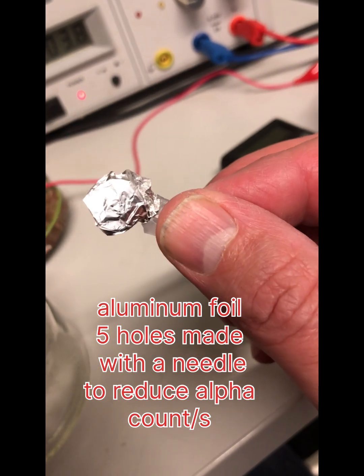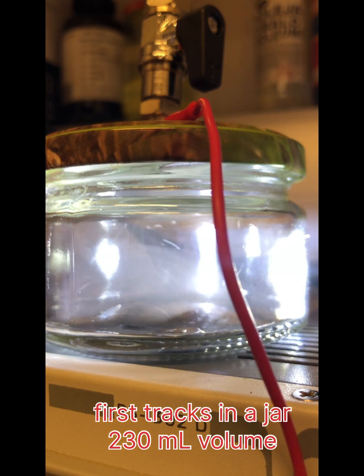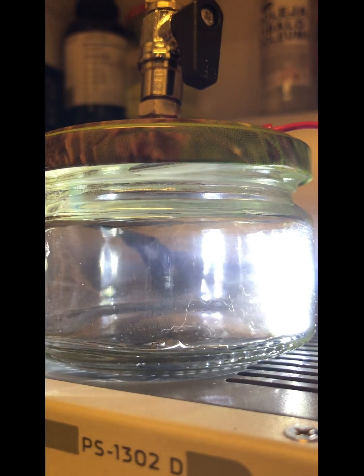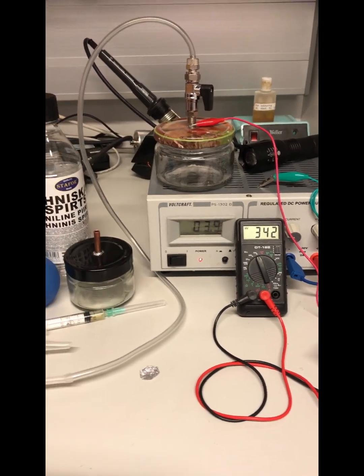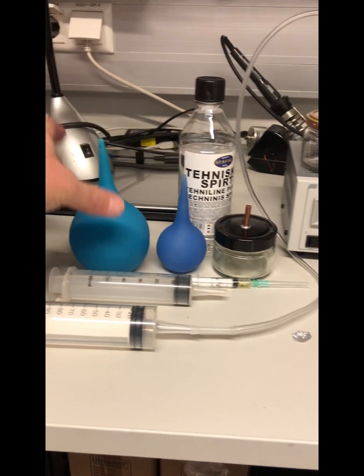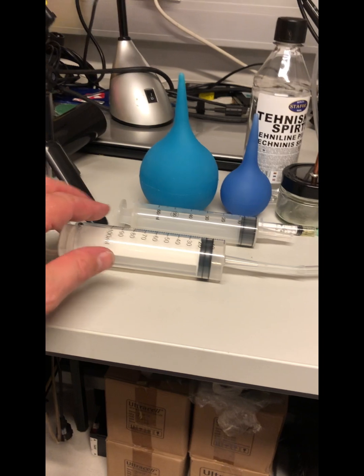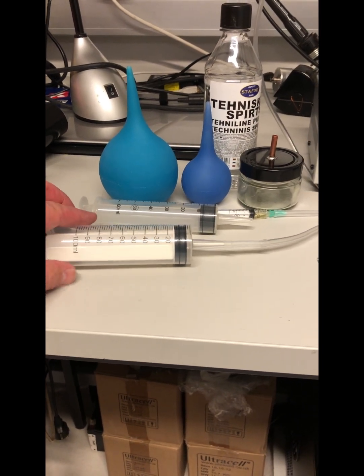Aluminum foil with some small holes. Here is the setup. I use a small jar, 230 milliliters volume. A 50 milliliter syringe was not enough to produce vacuum. With this it also did not work because I cannot overpressurize the jar. The lid lets air out, but I got results with a 100 milliliter syringe, which is used for veterinary purposes.